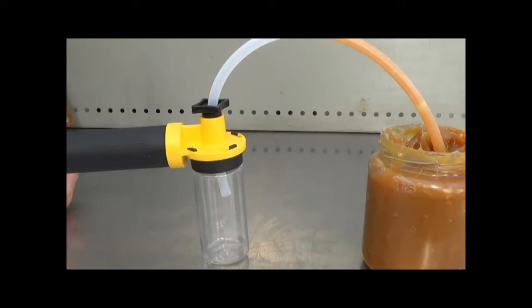If you encounter an air bubble before you are finished just pump up the vacuum again and let the flow continue.